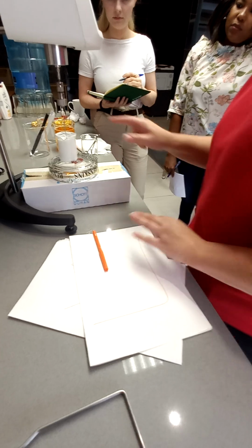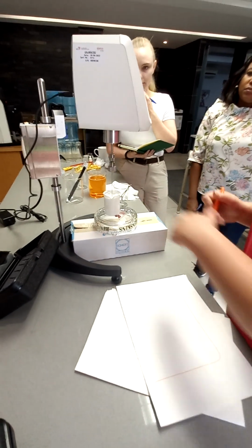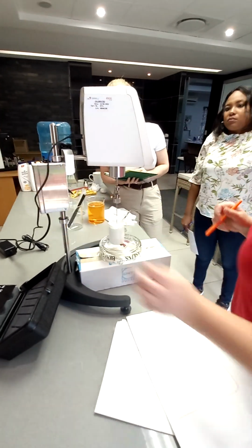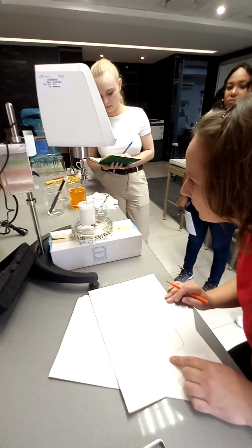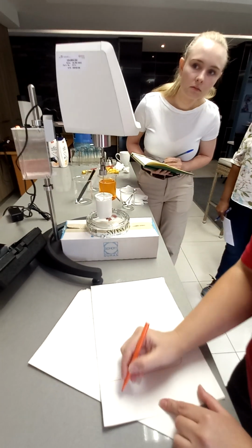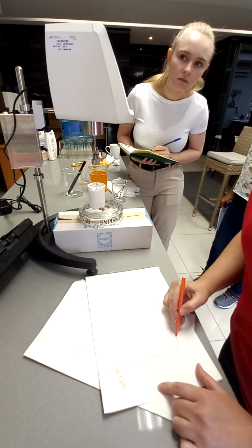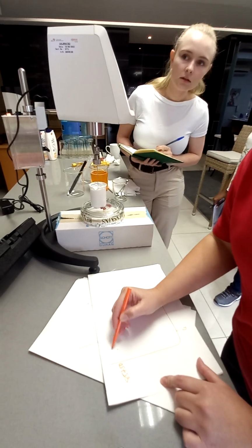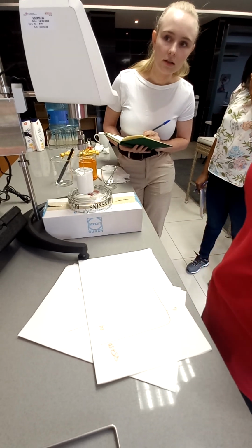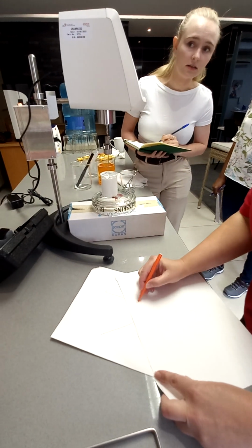Okay, so I haven't taken readings yet, and we're still just rotating at one point. So let's switch on, and then you guys must help me. Okay. So it's gone in a bit. Let's do 85,750. What was the torque more or less? 34. Okay. 91,750. 96.